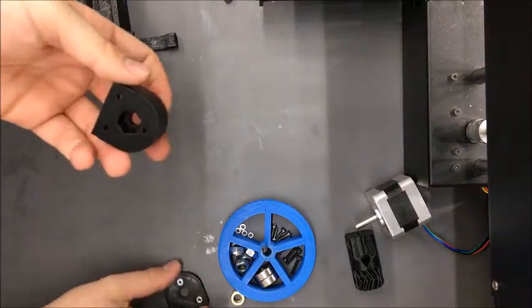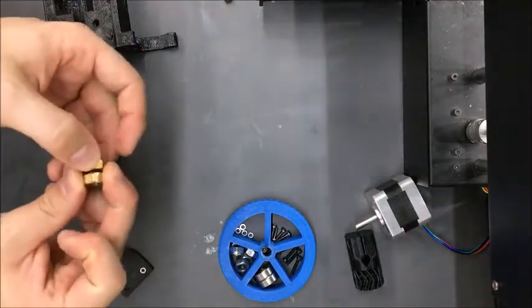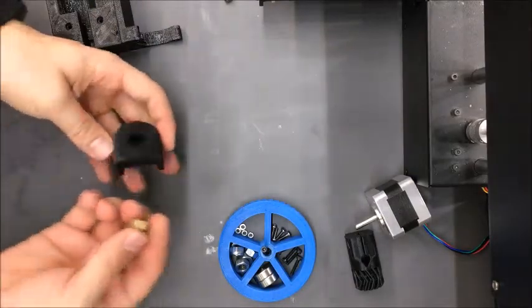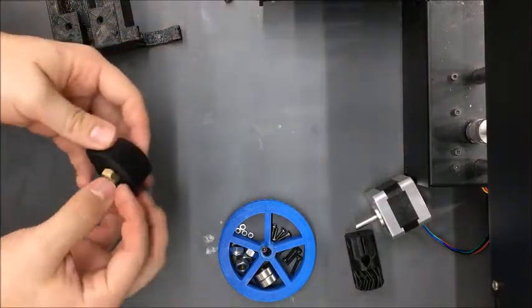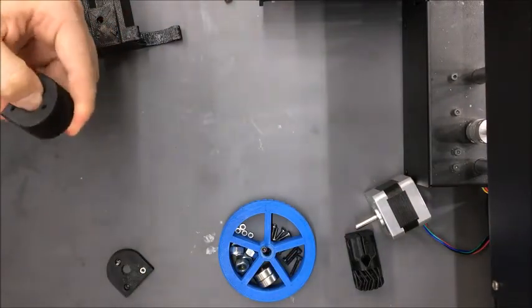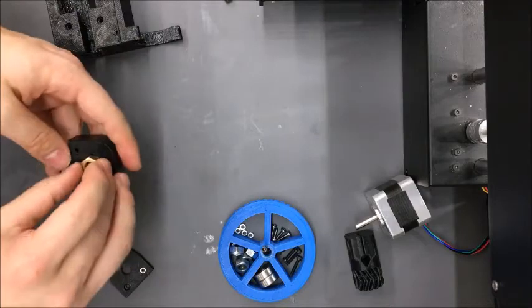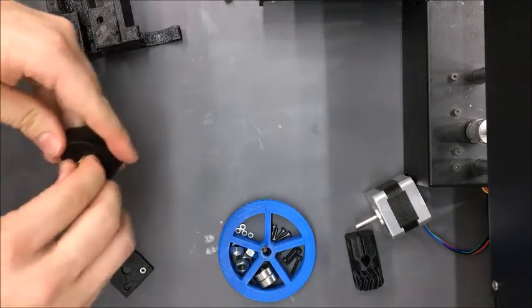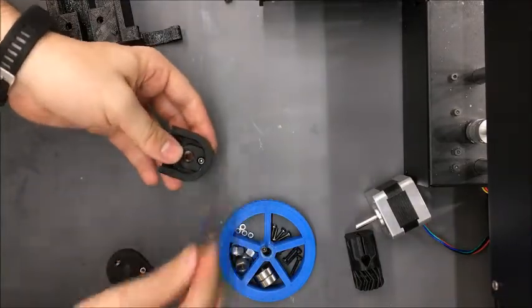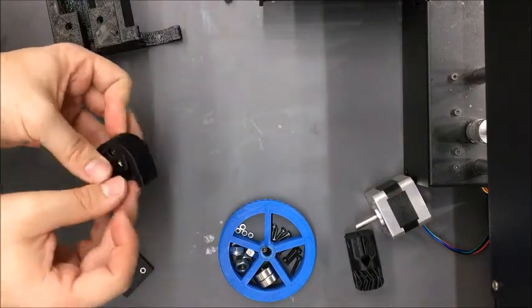The first thing we're going to do is take these two parts and put them together. These will hold the nuts that are used to actuate the syringe plunger. Get one of the hex nuts pressed in, then place the 3D printed ABS spacer between them — the interior diameter just has to be bigger than the lead screw. Push the second nut in, then press in three M3 by 10 socket cap bolts.